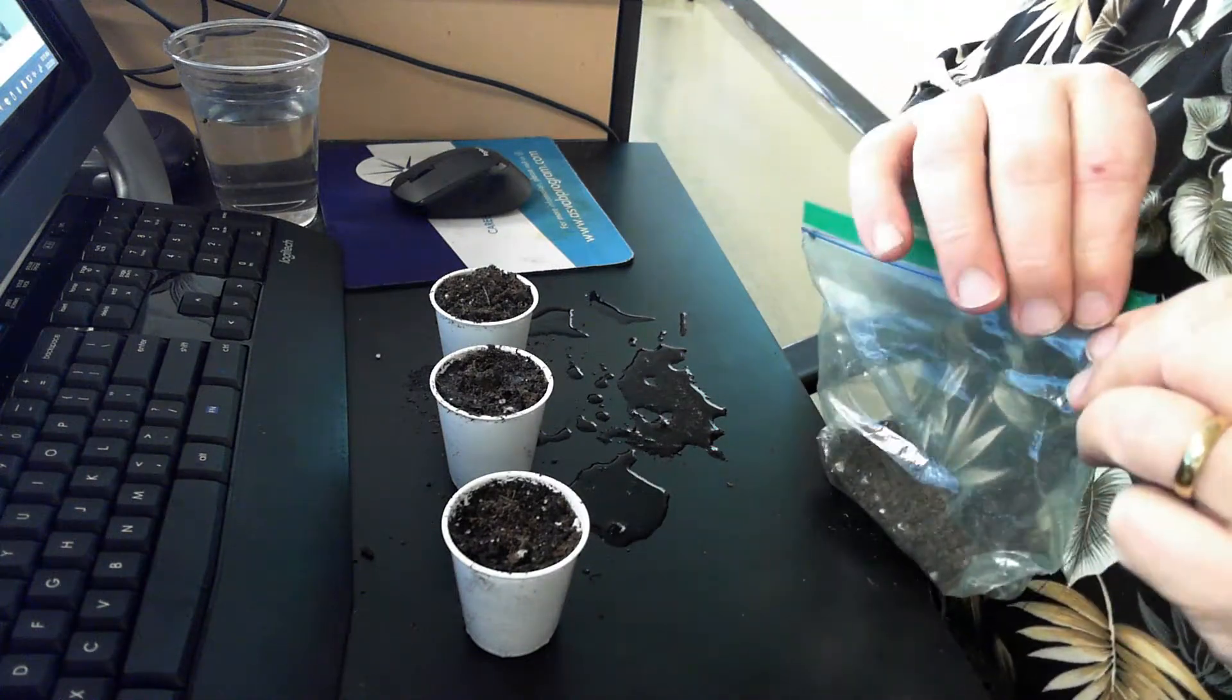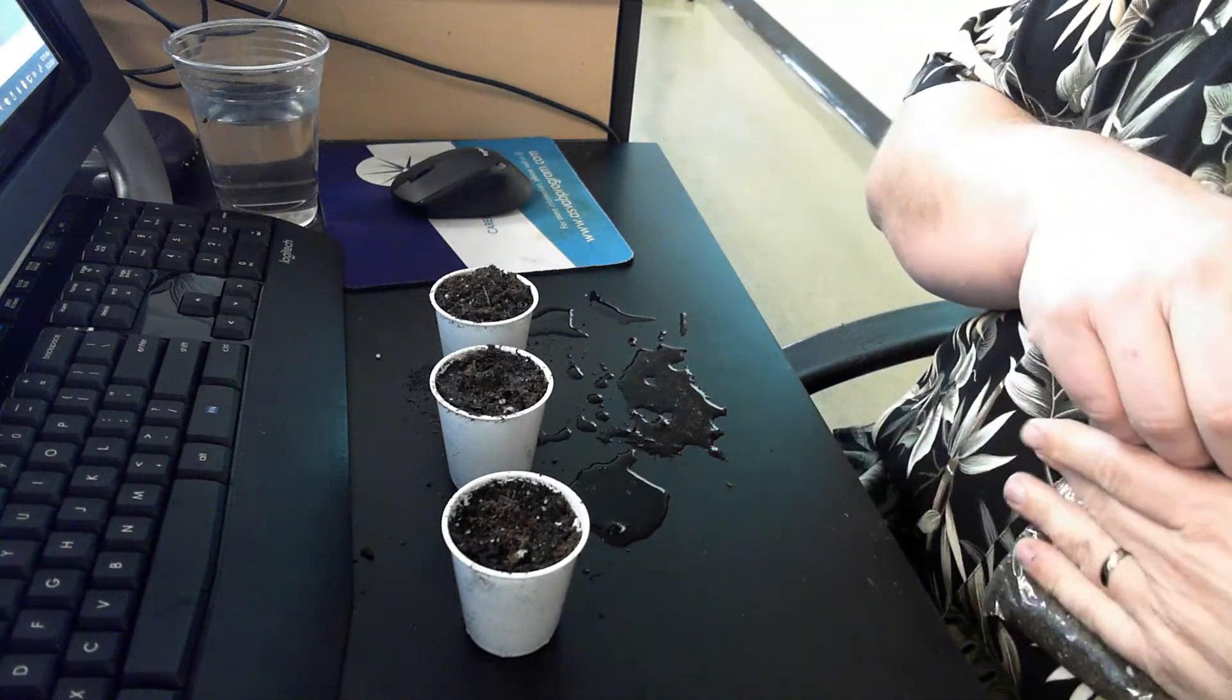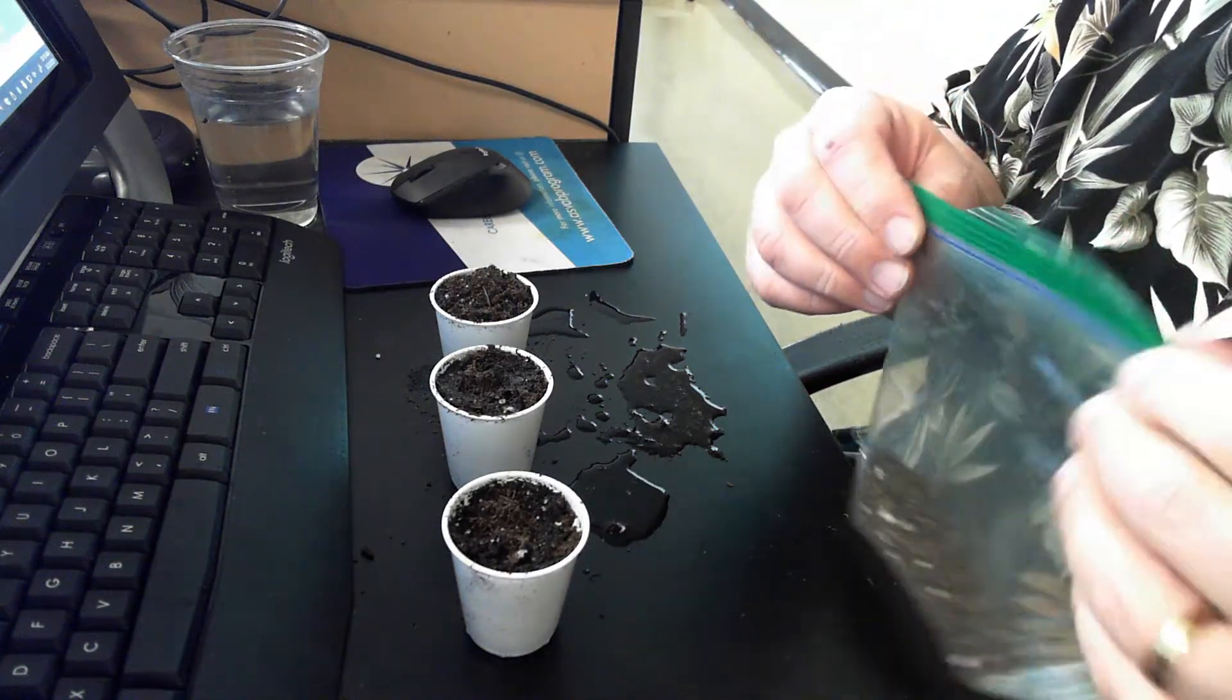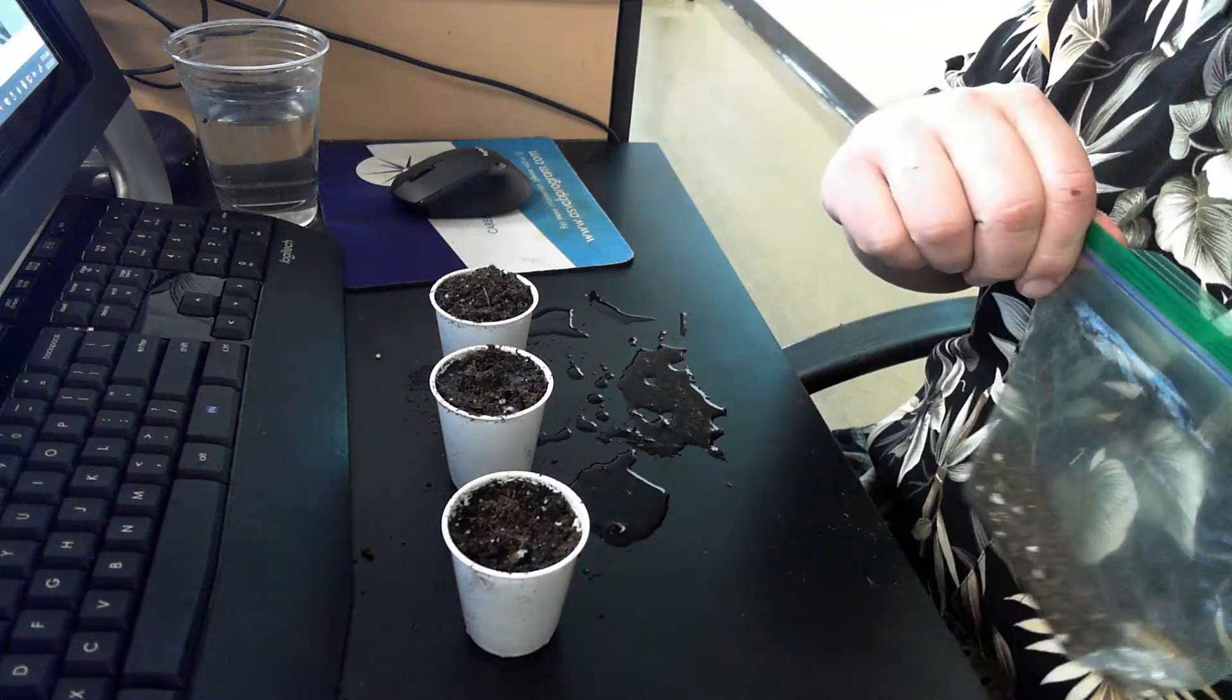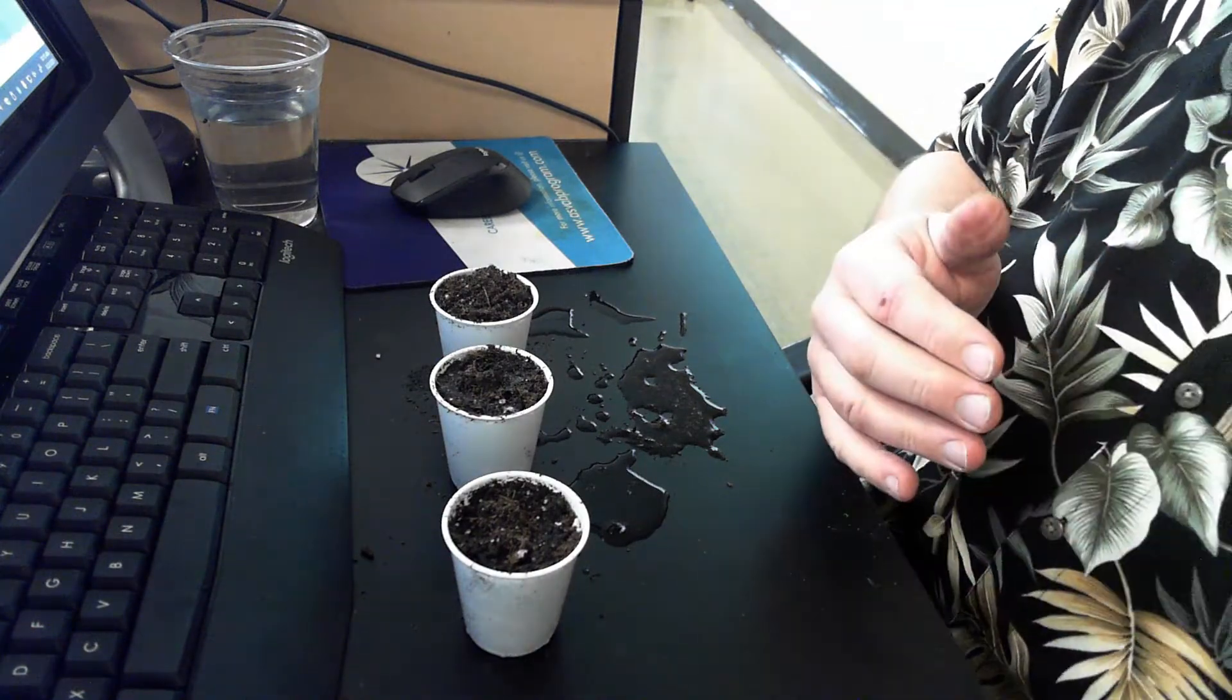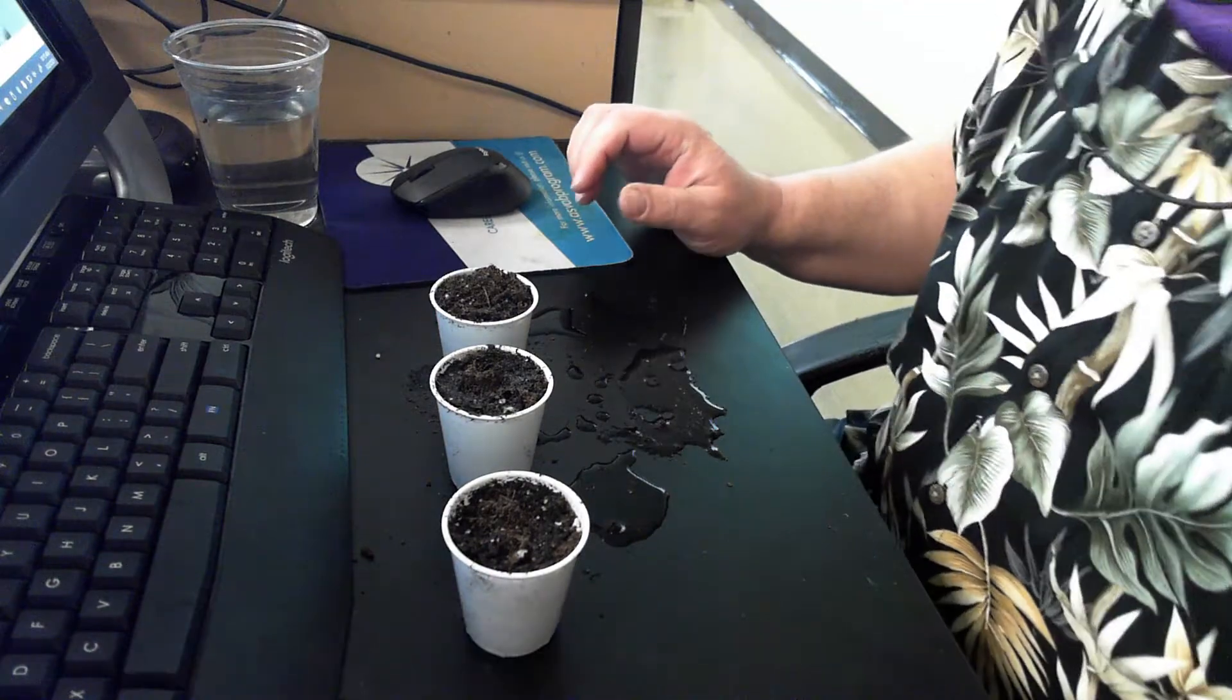Here's a healthy safety tip. You do not want to bury the seed deeper in the ground than the seed is tall. It's got to be able to break through the surface so that it can start to do its photosynthetic duty.